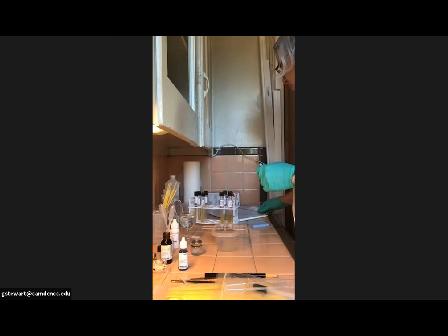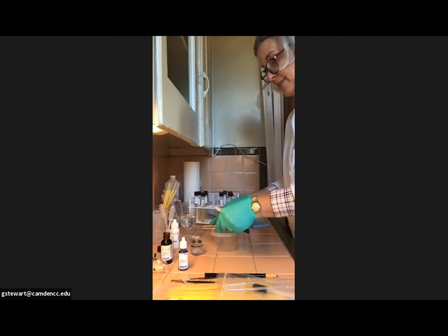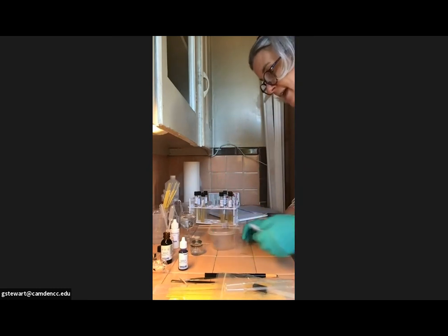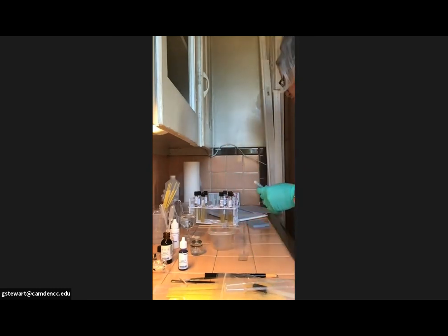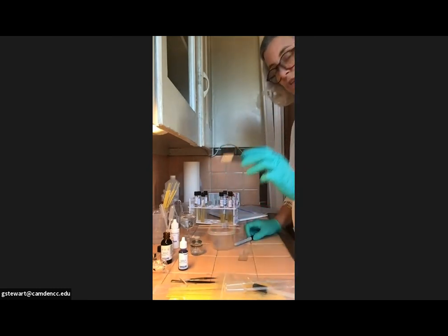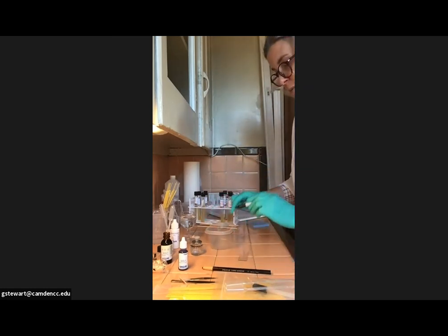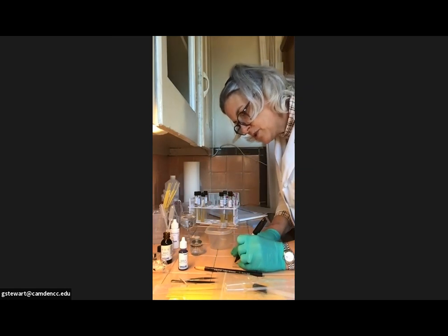And as I said, since I don't have the methylene blue, I'm only getting out 2 glass slides, and they do recommend cleaning them. I'm not going to do that. I'm going to skip that step. And I'm going to lay them right down here on my lab bench. And I am not going to use the China marker because we're not going to use any alcohol with these 2 slides. So I'm just going to draw a couple of circles.